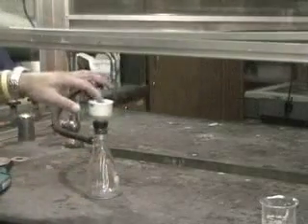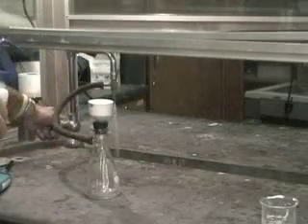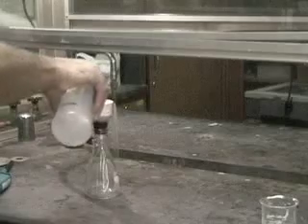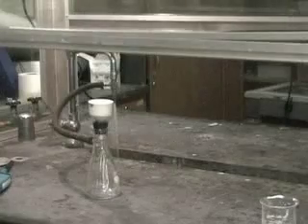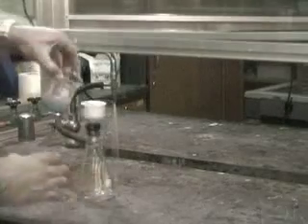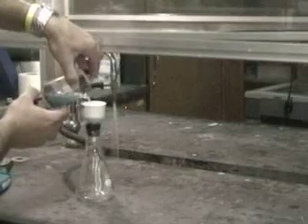The Buchner funnel filters with suction. In this case, the vacuum is caused by an aspirator. First, we wet the filter paper so it will seal to the funnel and none of the solid can pass through to the filtrate. Vacuum filtration goes faster because the vacuum pulls the filtrate through the filter paper and helps avoid the problem of the filter paper getting clogged by the solid.